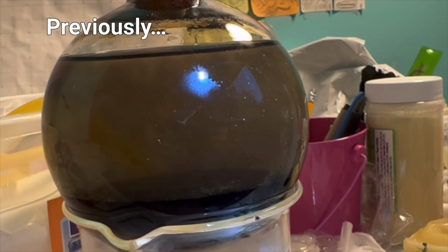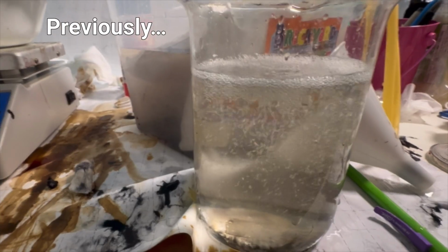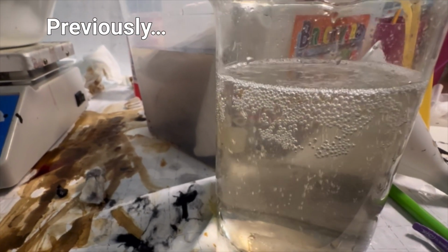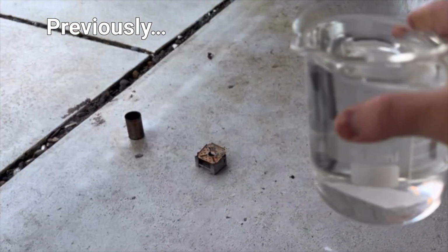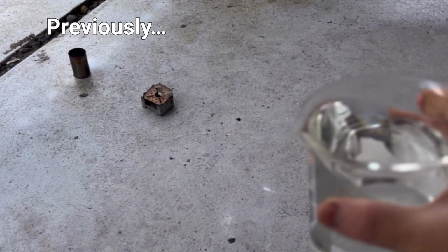As you can see, there's no more permanganate left in the round bottom. Not only was there no precipitate, I also couldn't boil the solution down because it was releasing acid fumes everywhere. This experiment was a failure, and I just wasted half of my day on nothing.